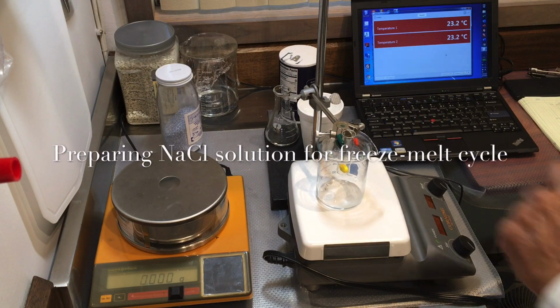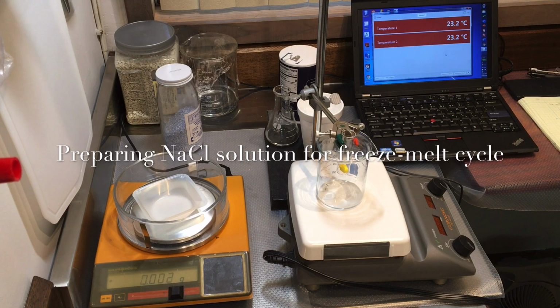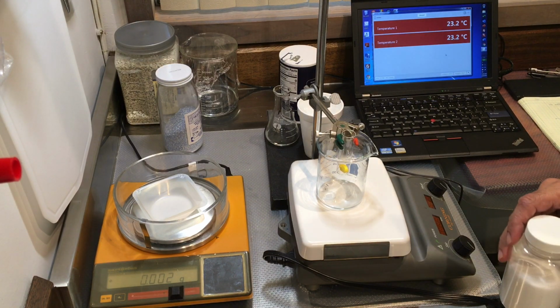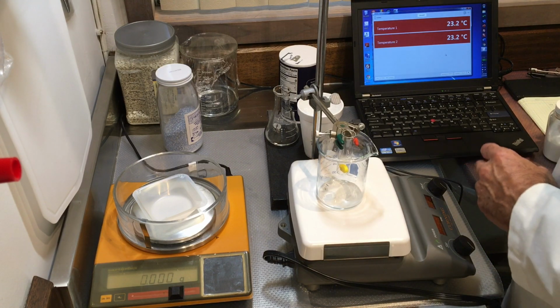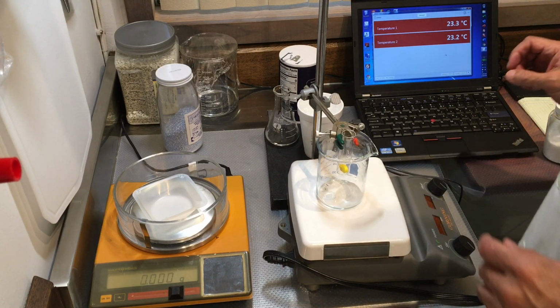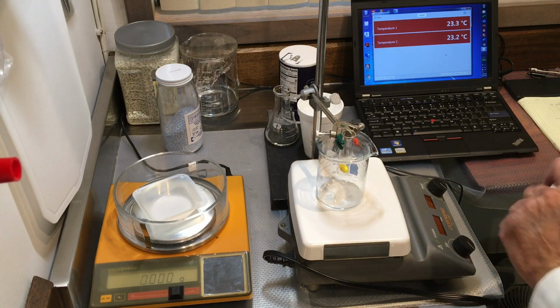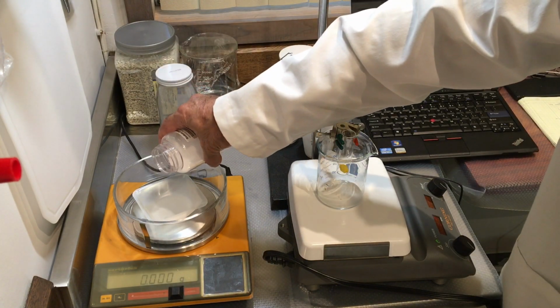So let's go ahead and start. So I'm going to weigh out 5.83 grams or close to it. We'll see how close I get of the table salt. And I'm going to add 100 grams of water to it. Okay, so 5.83 grams of salt to 100 grams of water. So let's go ahead and do that.